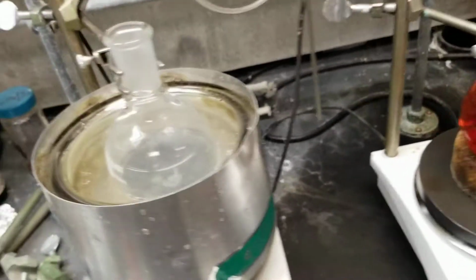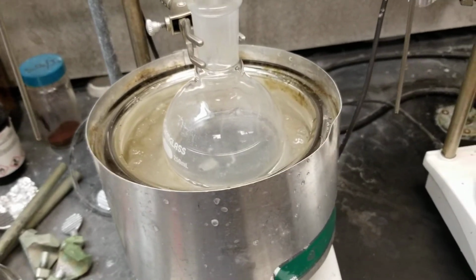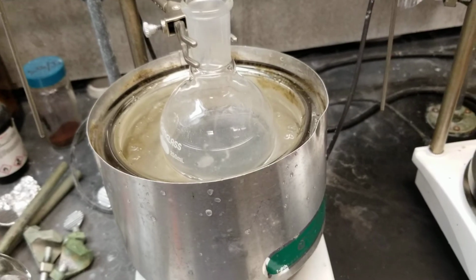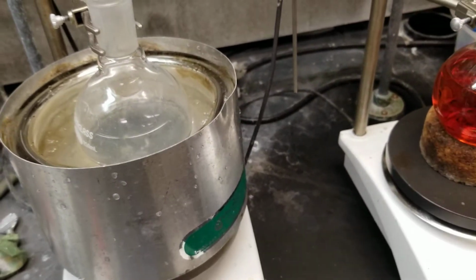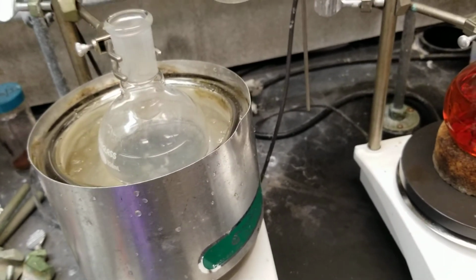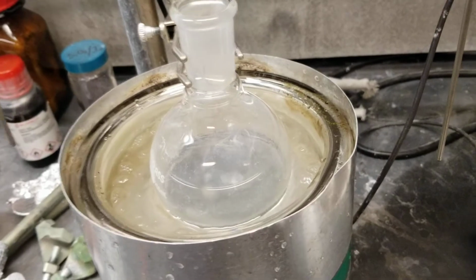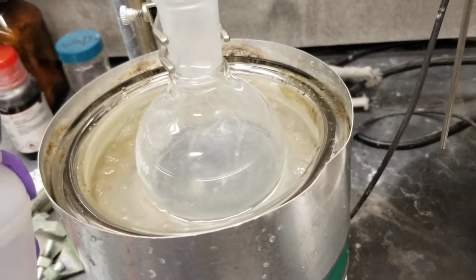The reason is that when we cool down a chemical reaction or a process here, we limit the amount of energy available to that system. And so we can get better control of it, we can get more selective processes to occur, and it just makes things a lot easier overall. So take a look at this here, and note what happens as I go to quench this reaction.